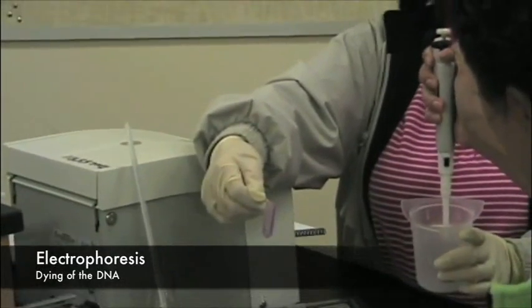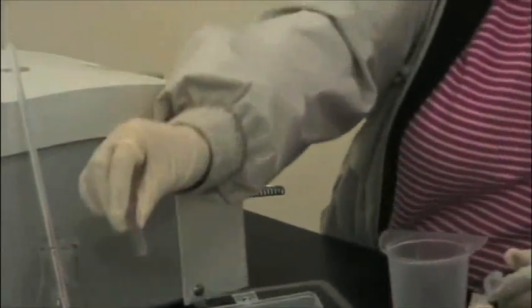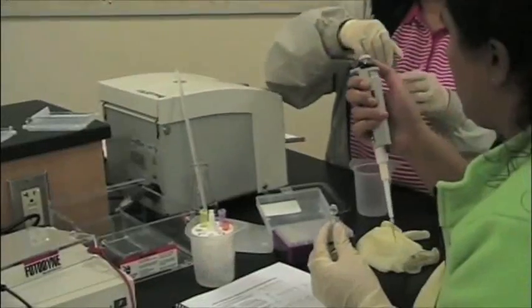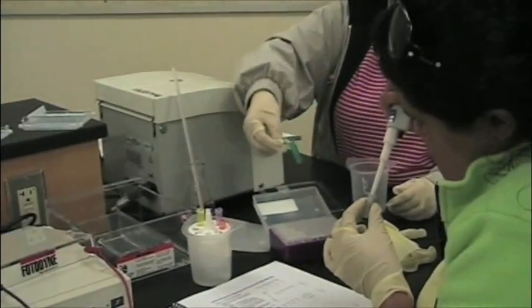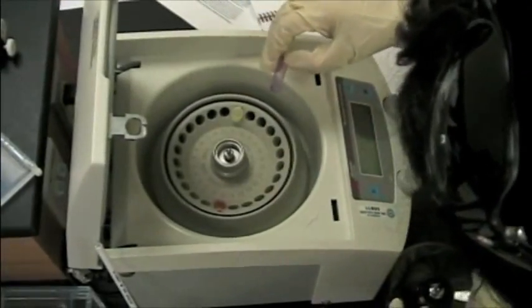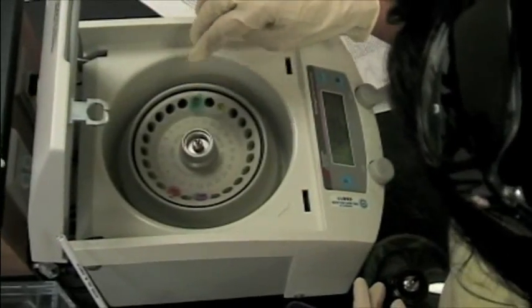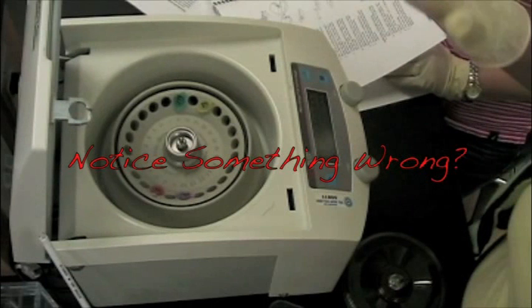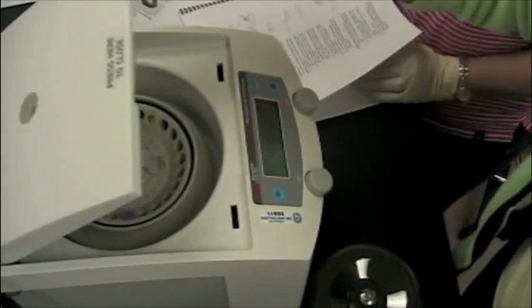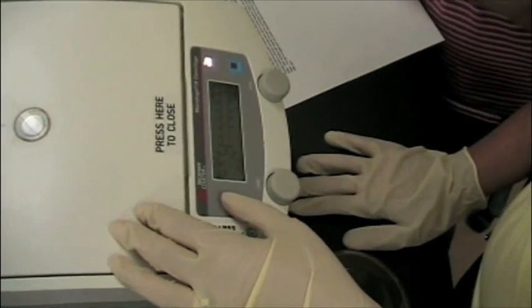Why is this so very exciting, you may ask? Well, here it is. We used micropipetting all throughout this experiment. The first step was to cast an agarose gel. The gel was prepared to load the DNA strands to run them through the electrophoresis chamber. In order to separate the DNA strands, we had to use several different steps. First, we added a restriction enzyme to cut the DNA segments. This would provide us with different samples from different individuals. In addition, loading dyes are used to make the reading of the samples easier. The centrifuge is used in this experiment to move the small volume of DNA to the bottom of the well to make it ready for micropipetting.